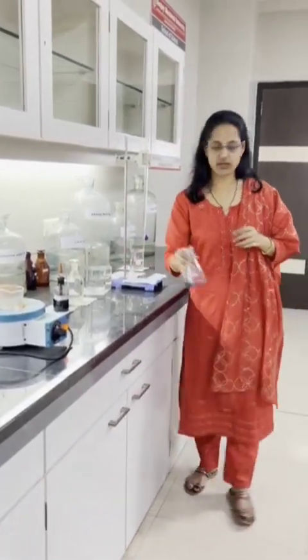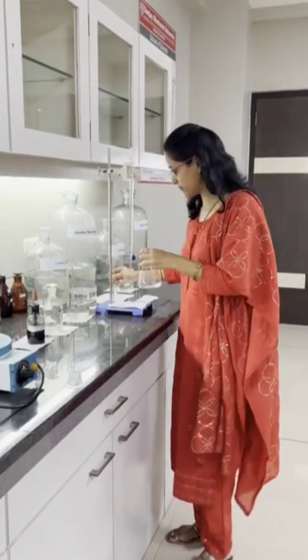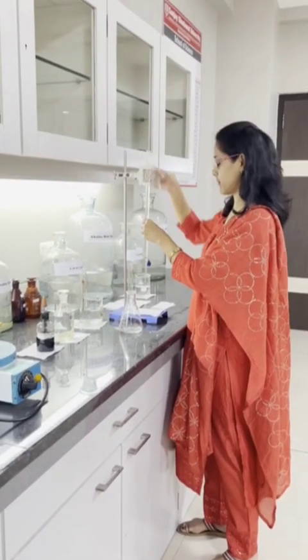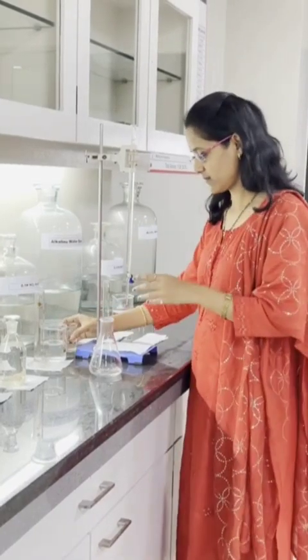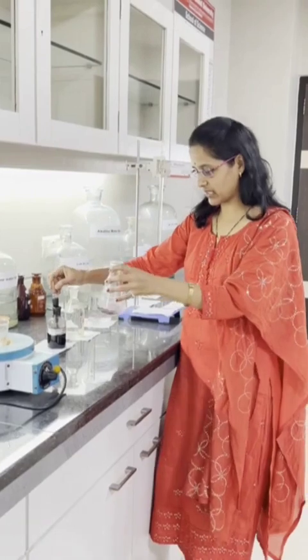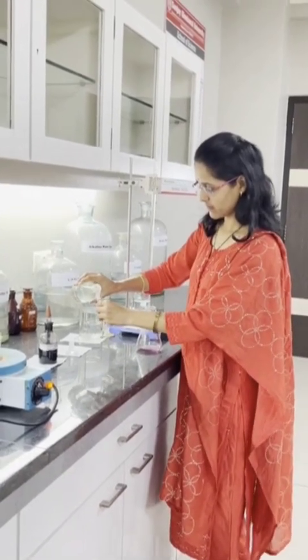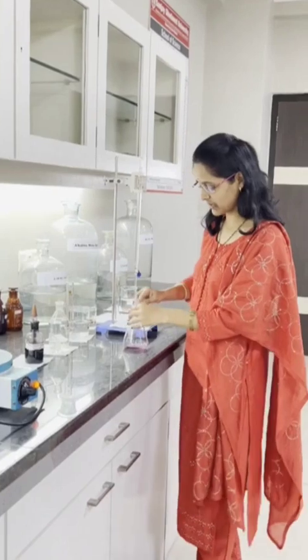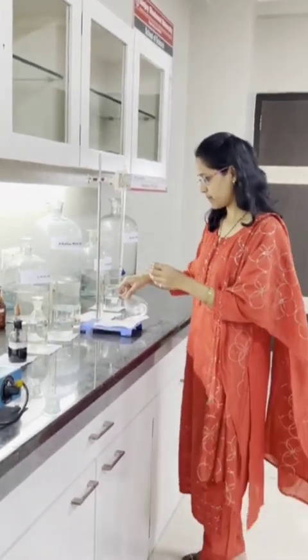This is the boiled water. I am taking the boiled water for the titration to calculate the permanent hardness. I will fill this burette to 0 while calculating the permanent hardness — lower meniscus. Again, the same steps we have to follow: first add EBT indicator, then you will get the wine red color. Now again we have to add 10 ml buffer solution. Same process as for total hardness, we have to follow for permanent hardness.